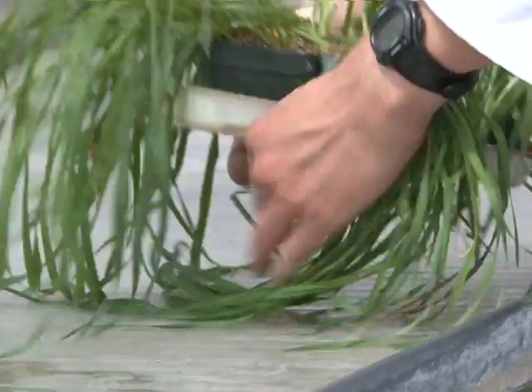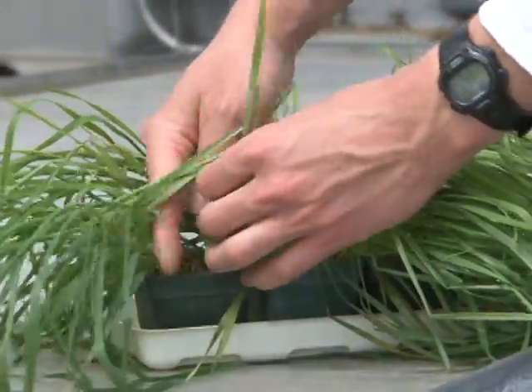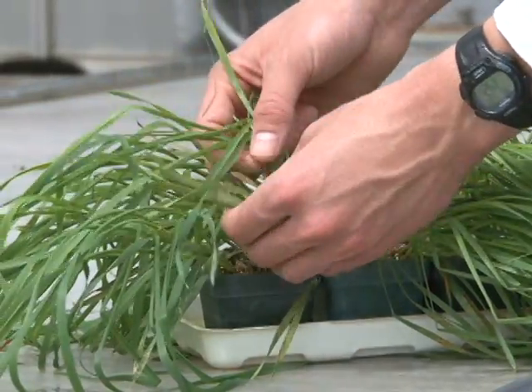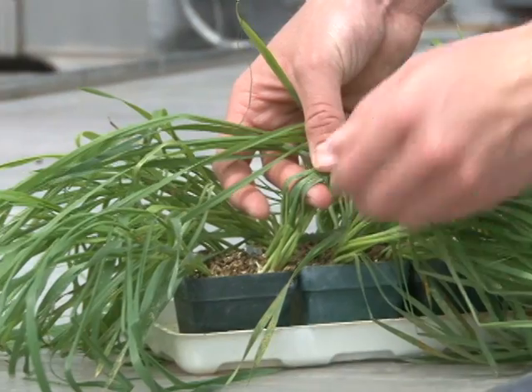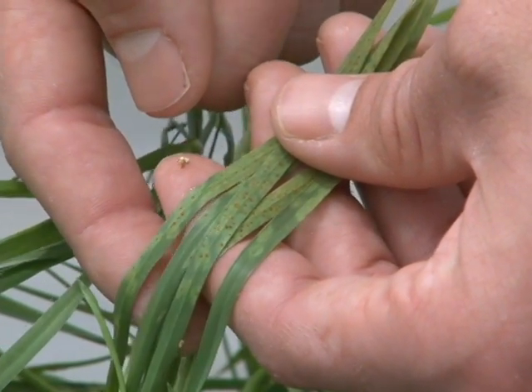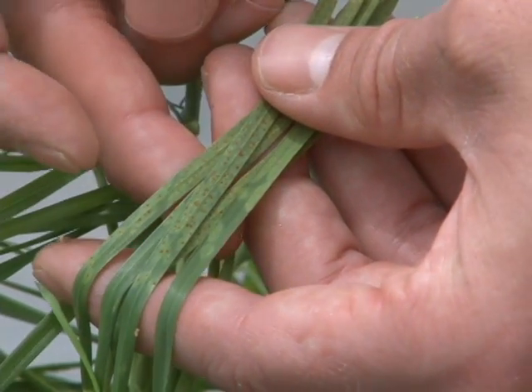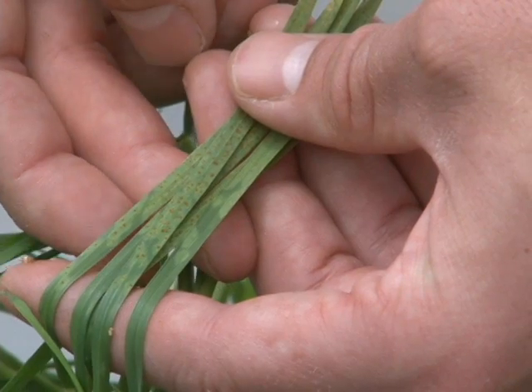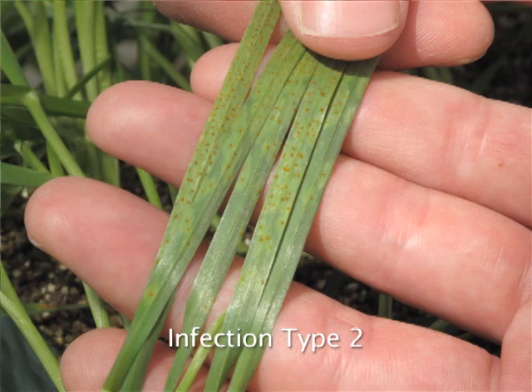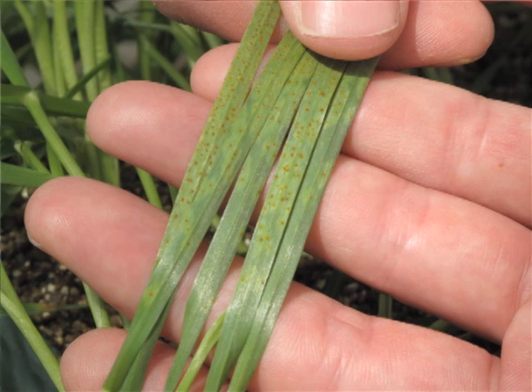Infection types can be intermediate between a zero and a four. As an example, I'm going to show this differential which has the gene SR24. You can see that the rust development is much less than with the infection type of four, however it is greater than zero. We classify this as a two infection type. You can see that the sporulating areas are quite small and they are round shaped.